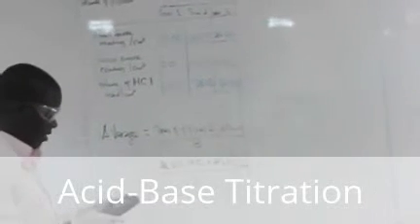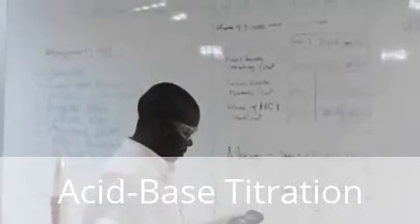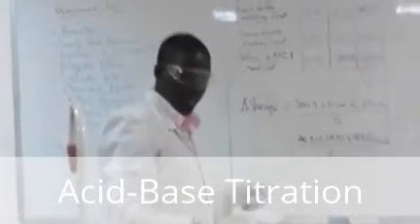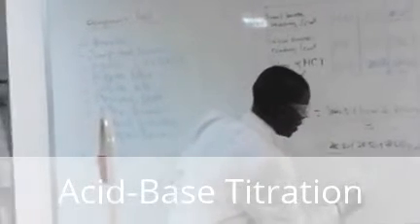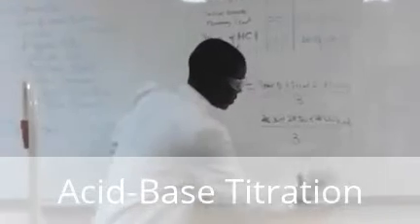So 28.50 plus 28.50 plus 28.60. I divide by 3, I get 28.53 cubic centimeters.